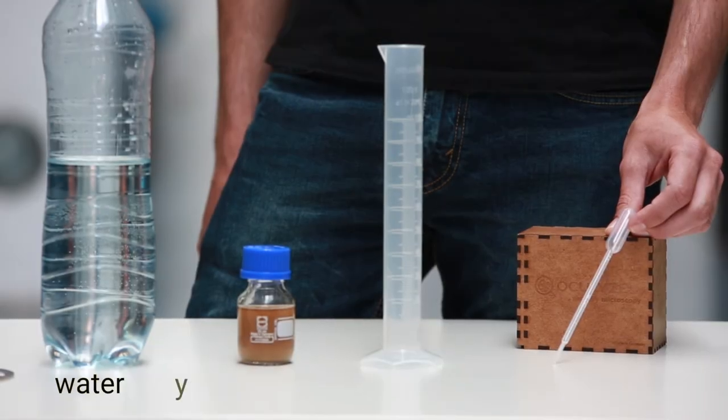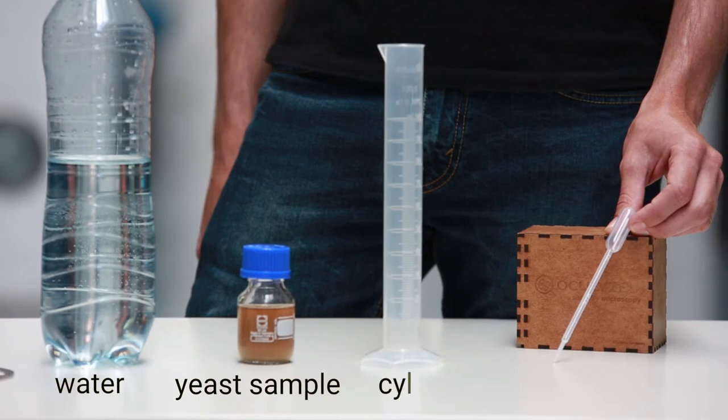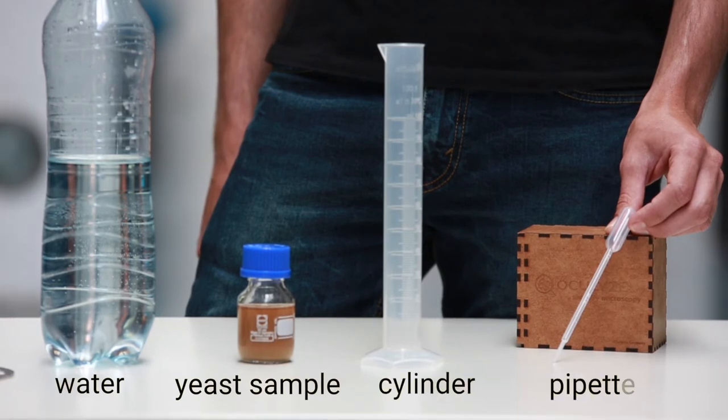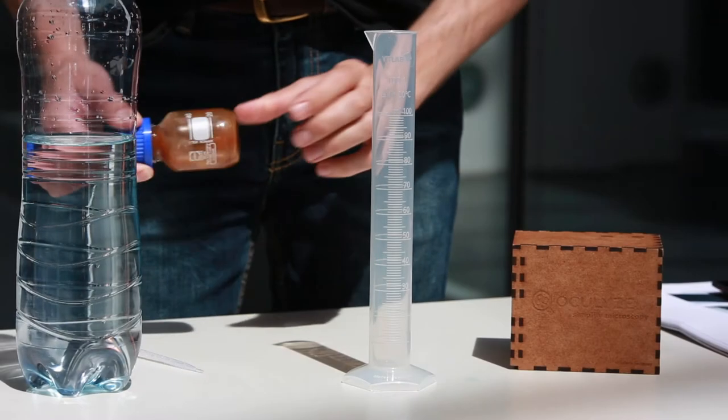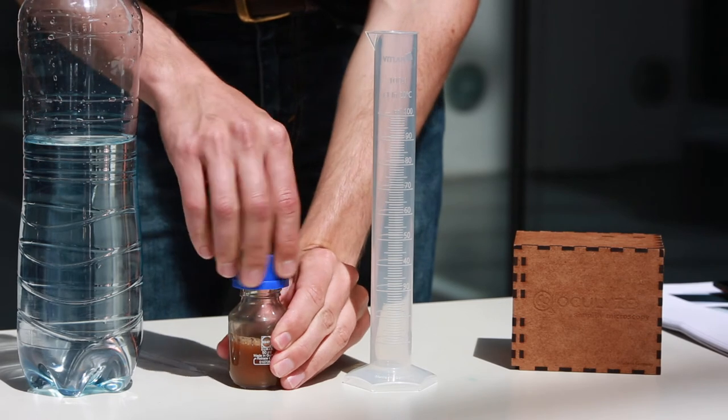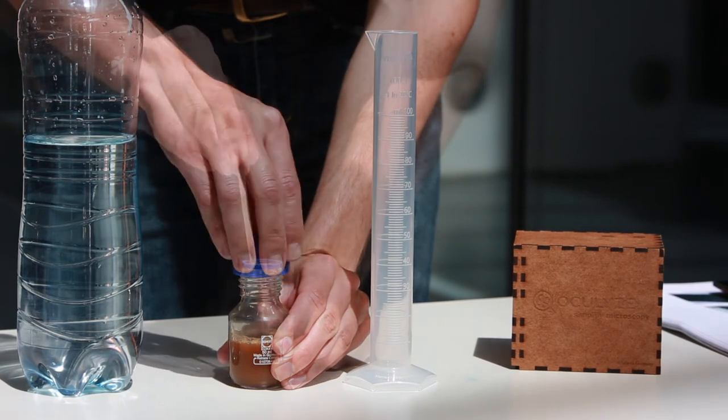Let's begin with dilution. This is what you'll need. Make sure your yeast is well mixed. Step 1.